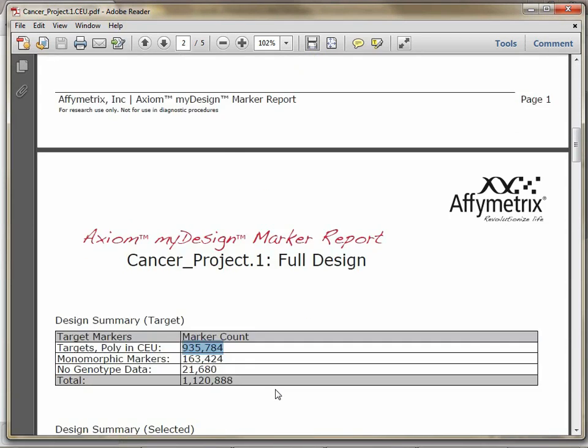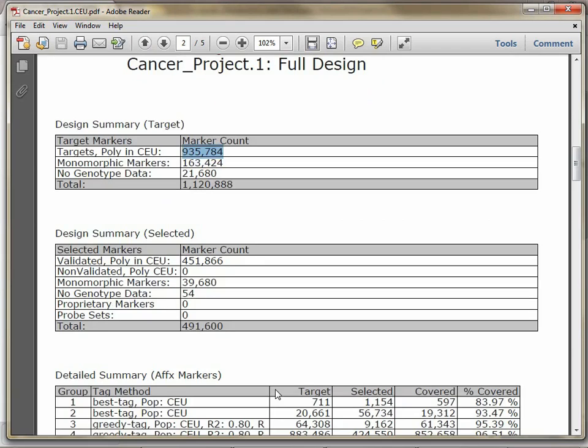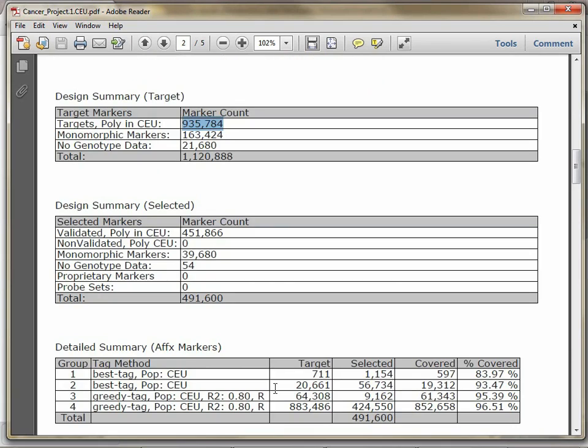If you scroll down to page 2, here you can actually see the summary of the design attempt itself. At the top, we have a summary of what the target markers are, or the SNPs that we are interested in. The middle includes a summary of what the markers were and the breakdown for the markers that were actually selected to go onto the array, and then a detail of the number of markers selected for each marker group is shown at the bottom.